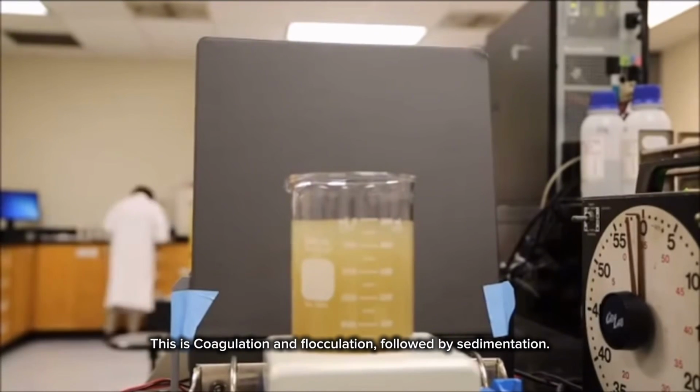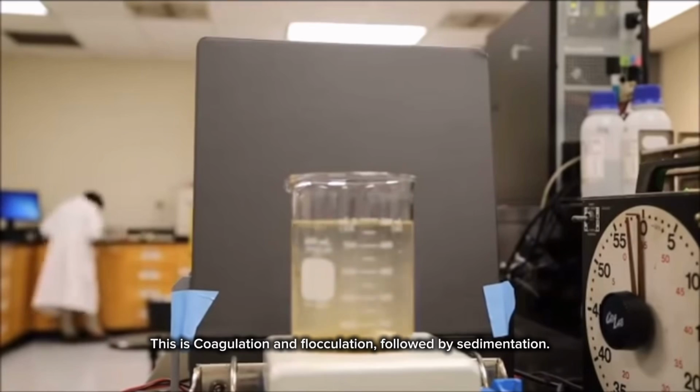After standing, what happened to the sand? And what happened to the clay? Sand settles quickly by sedimentation. Clay stays suspended unless coagulated. So what is this purification process called? This is coagulation and flocculation, followed by sedimentation.